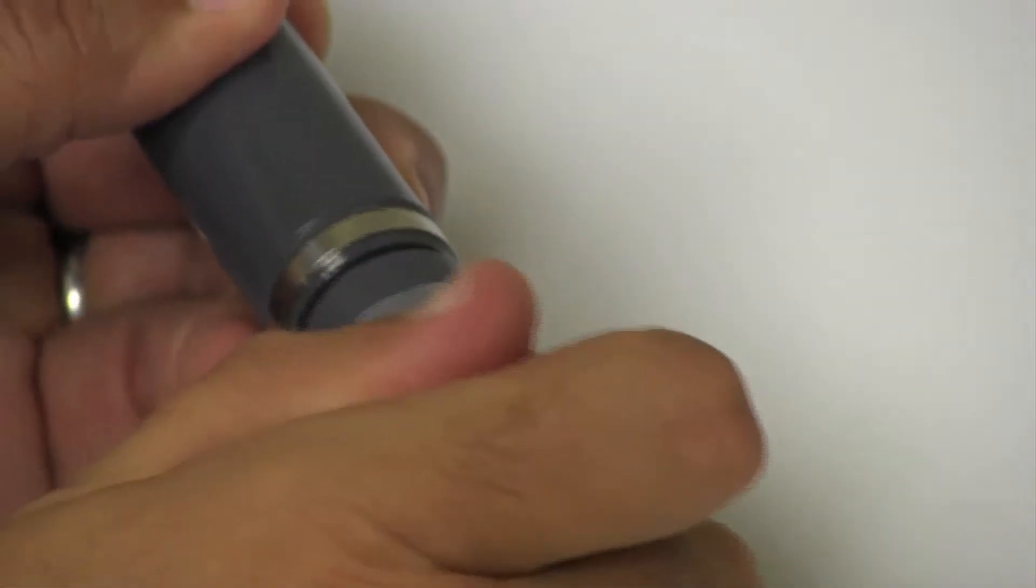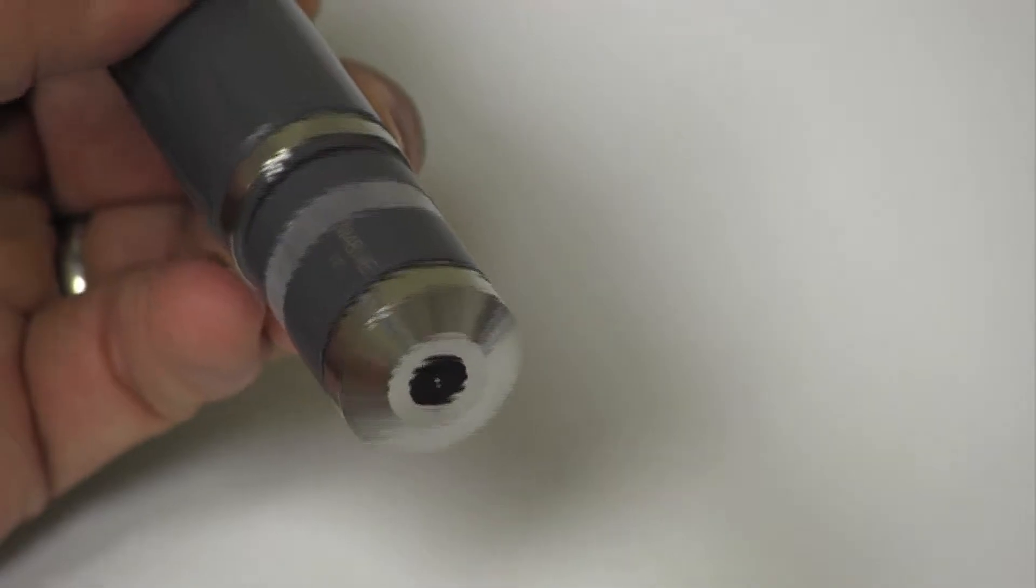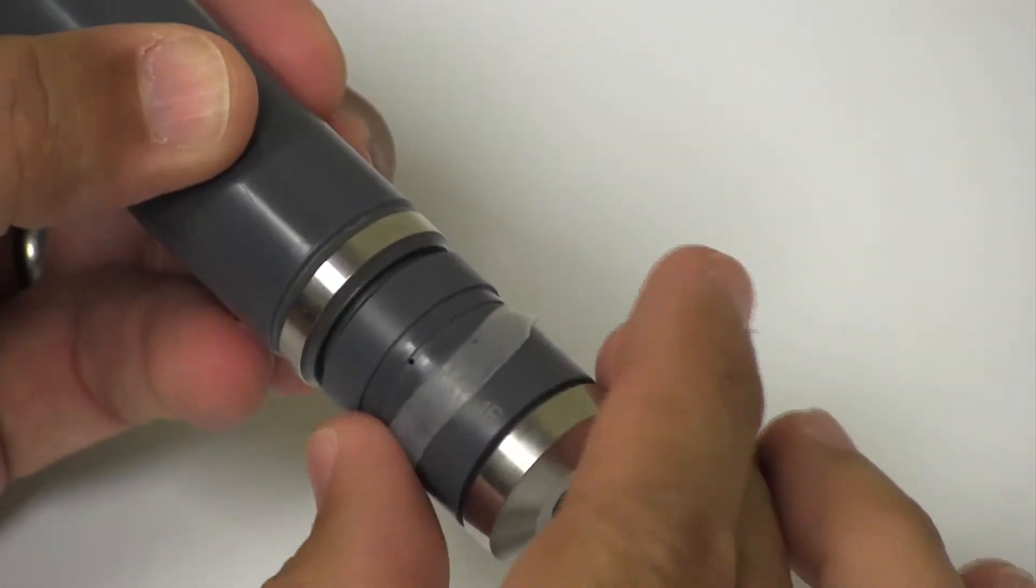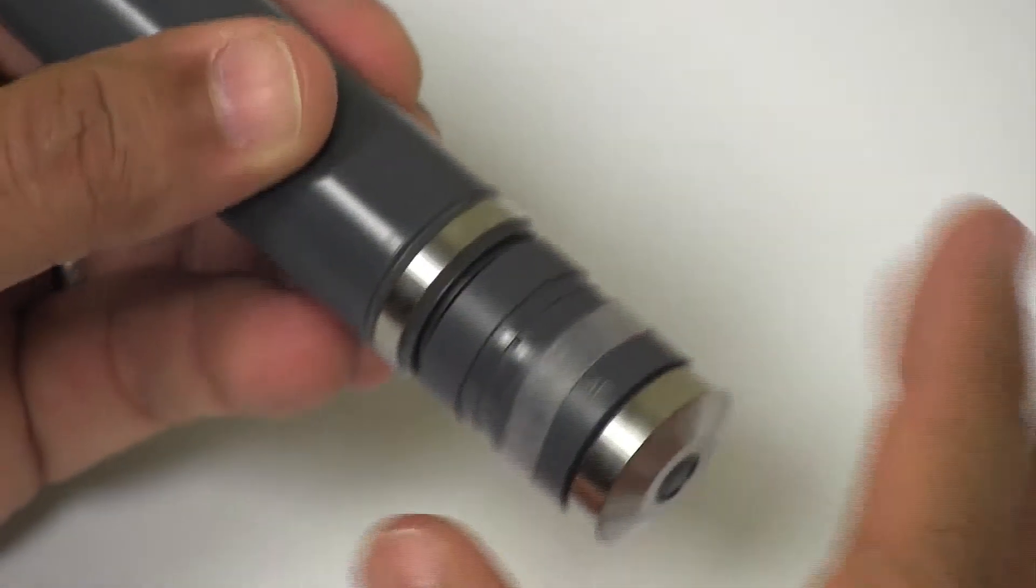Certain precautionary measures must be taken. Before a membrane cap is ever removed, it is critical to slide the elastic seal away from the tiny vent hole. Failure to do so can result in permanent damage to the membrane.